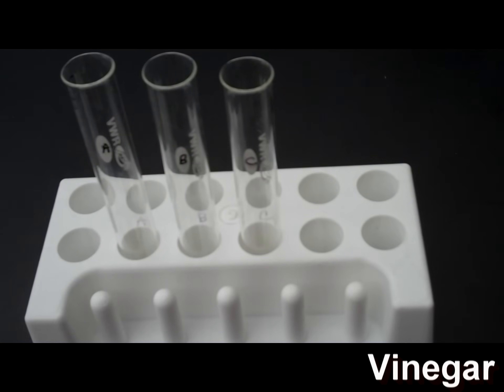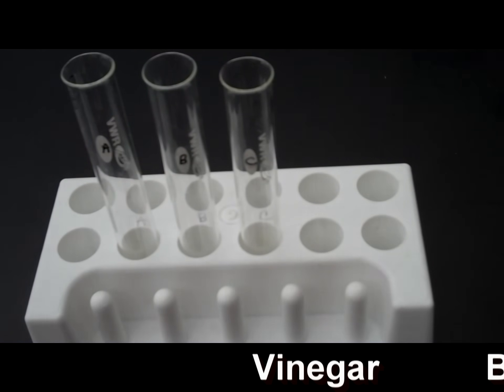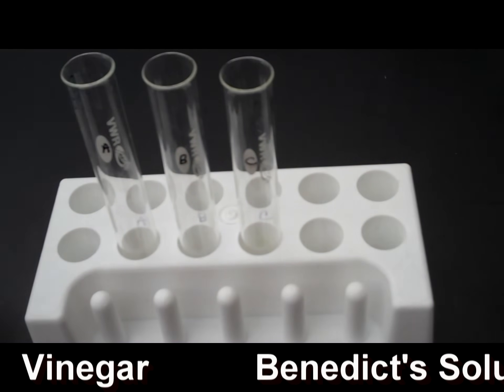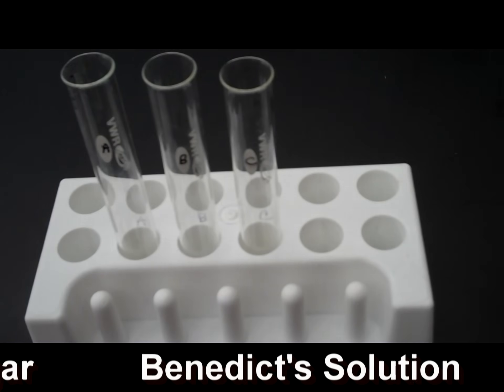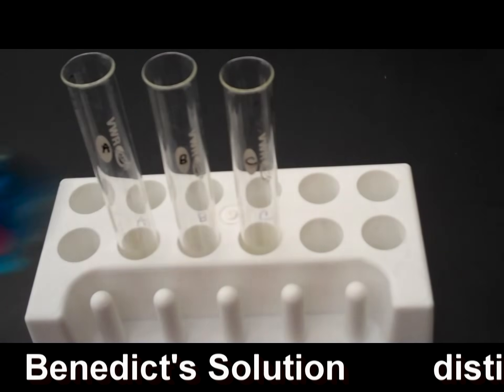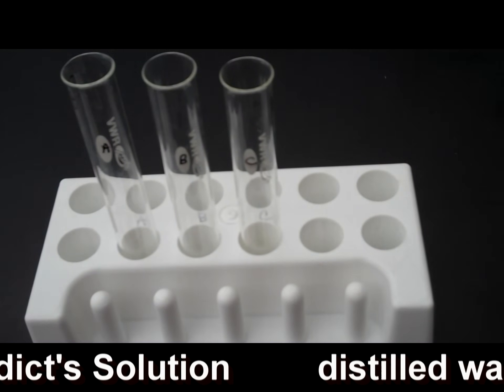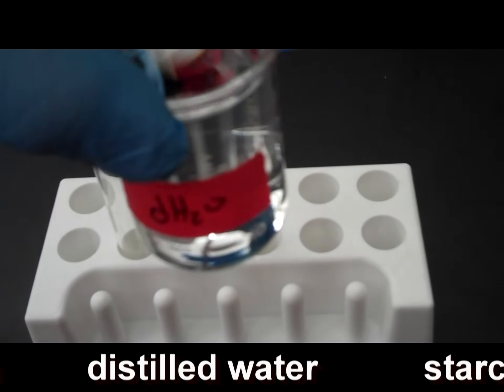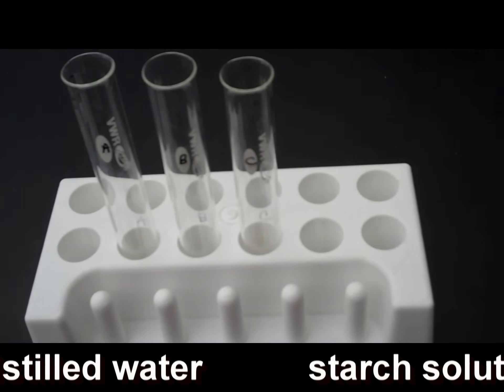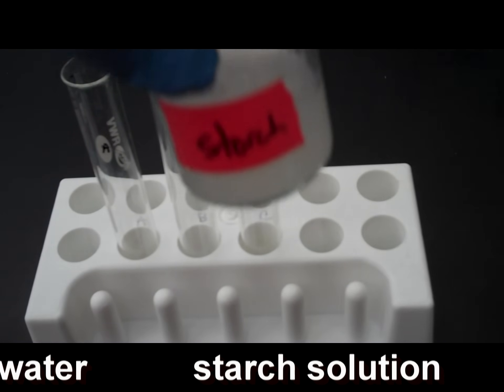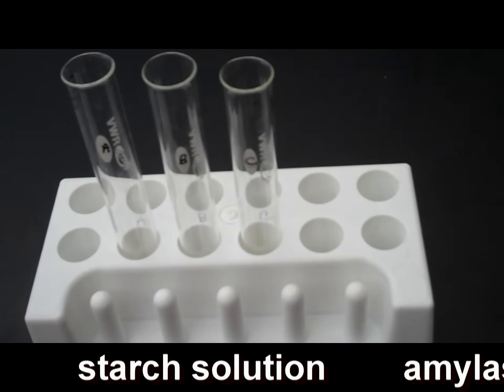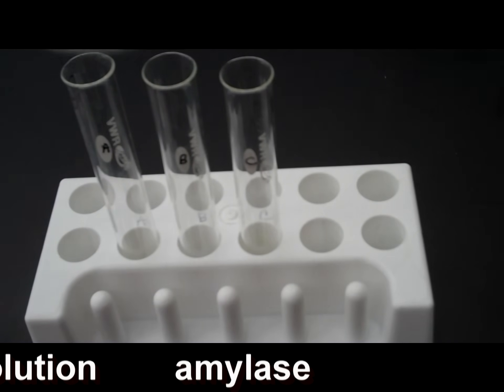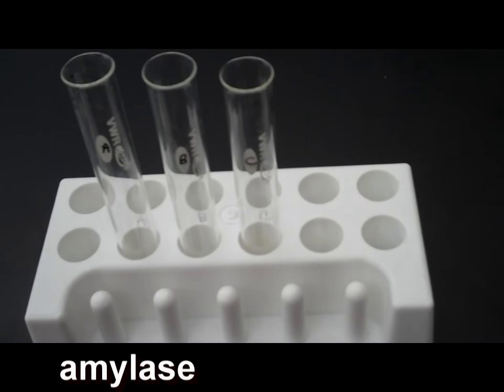So, let's look at some of the supplies that we're going to be using in this lab. We're going to be using vinegar, Benedict's solution, distilled water, starch solution, and a digestive enzyme called amylase.